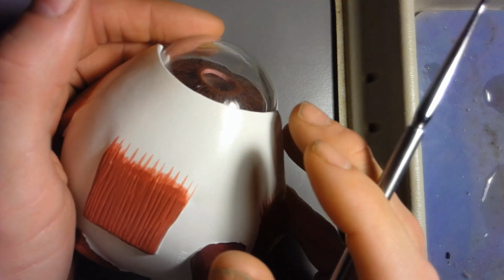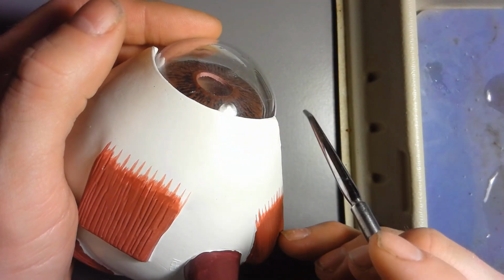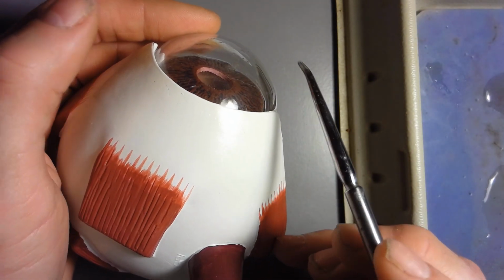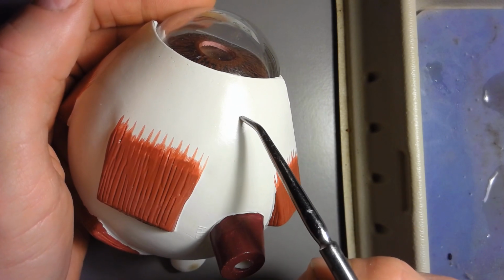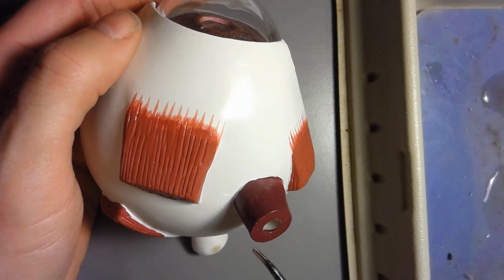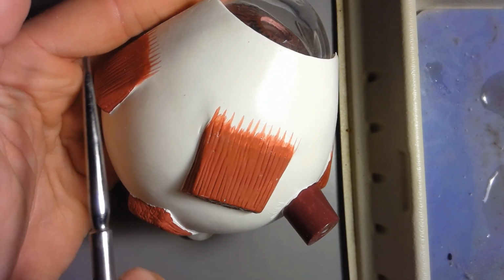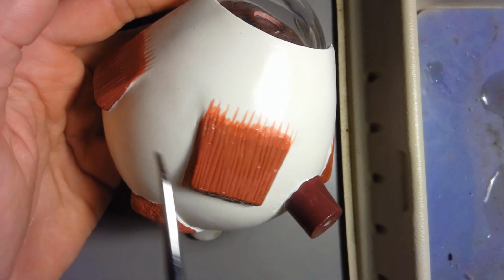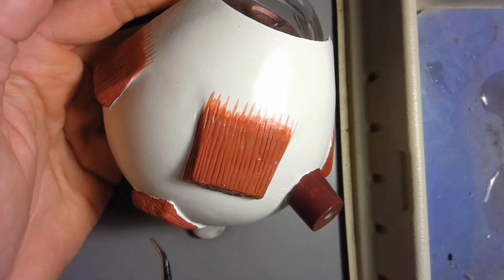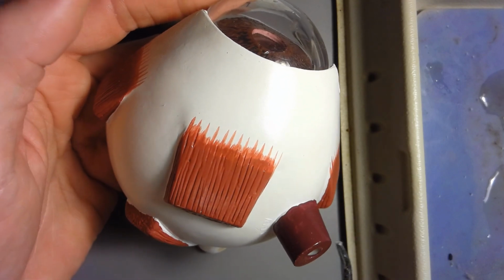The conjunctiva on the list, we will be getting to that with the actual eye because this eye does not have a conjunctiva. The sclera of the eyeball is the white part of the eye. Next we have the extrinsic eye muscles, and so all around the outside of the eye here you see these muscles right here, right here, right here. These are all considered extrinsic eye muscles. Extrinsic meaning outside. So outside of the eye are muscles.